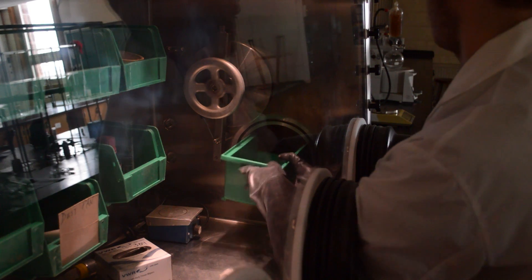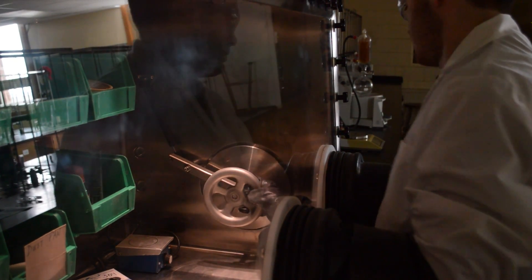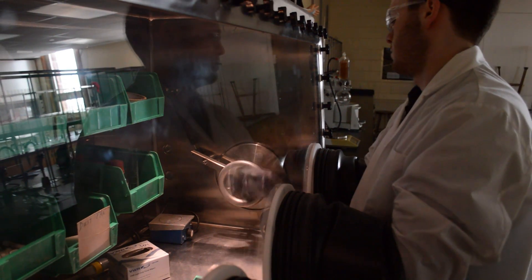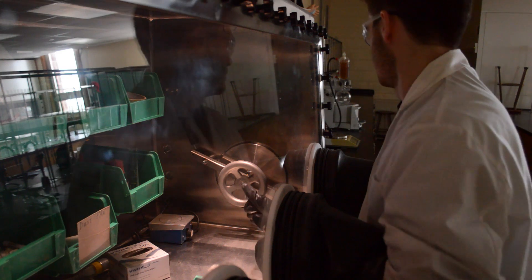We can just place this back in here with everything in it. The same procedure we use to close the door on the outside, we're going to finger tighten it until we can't anymore, give it another about a quarter of a turn, and then you can just come out slowly.